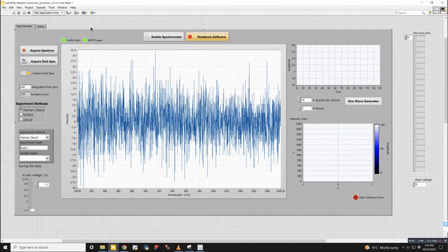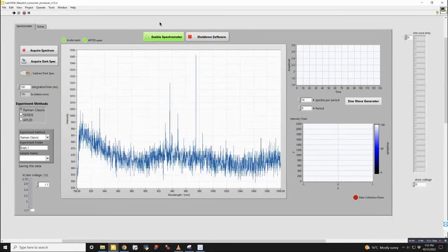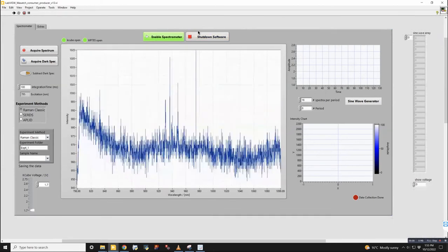So if I run this right now, the default value is to have this spectrometer enabled, so that right when you boot it up, it's reading spectra out immediately. But if you didn't want to do that, then you could click this and run it. So I'll leave it disabled right now. And when I click the run button, you'll see that it turns to enabled right away, because that's the default value. The reason it switches to that is that very first thing that runs.